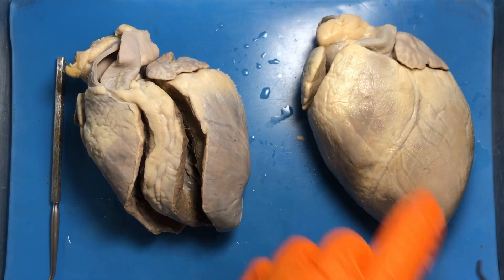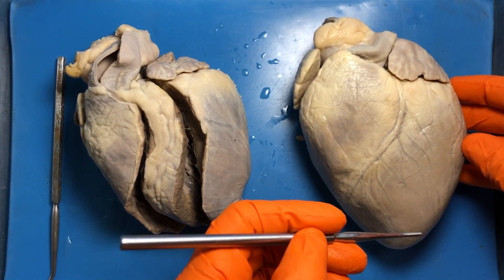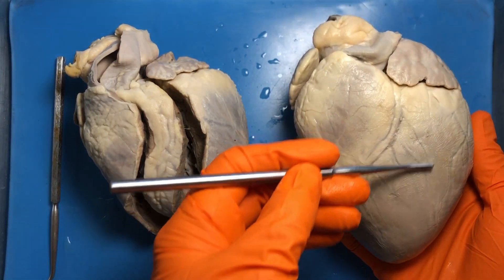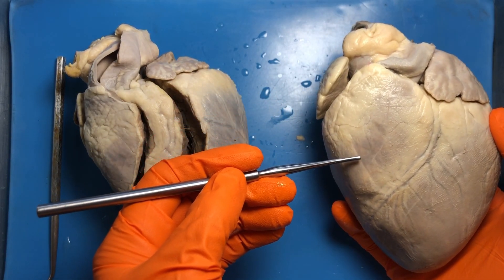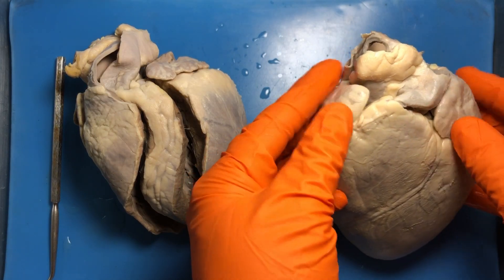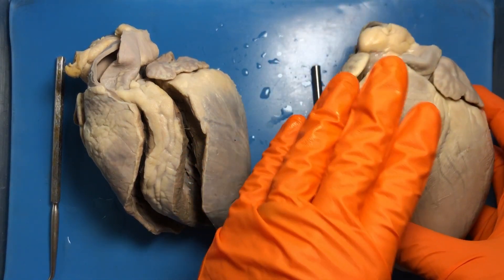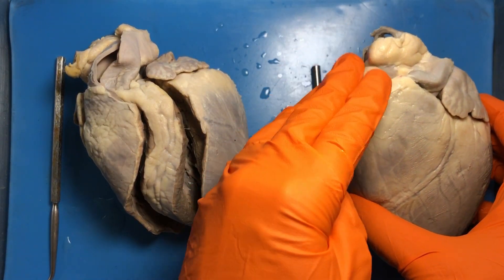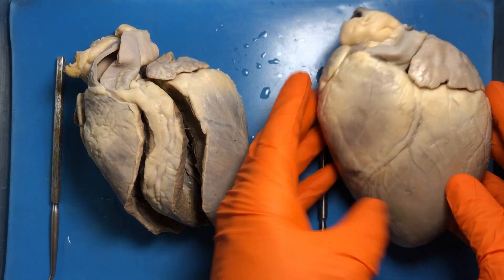The pointy part of the heart is called the apex, and the apex is mostly associated with the left ventricle. So when you're looking at the heart, this is the left ventricle and this will be the right ventricle. These little flap-like structures are called auricles — they're extensions of the atria. This is the right auricle, indicating the right atrium, and this is the left auricle, indicating the left atrium.